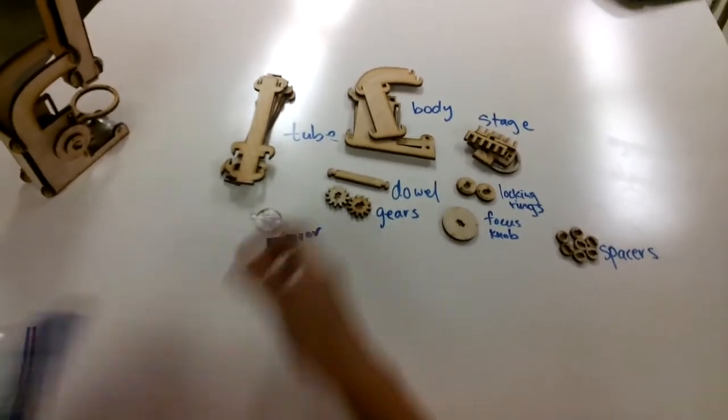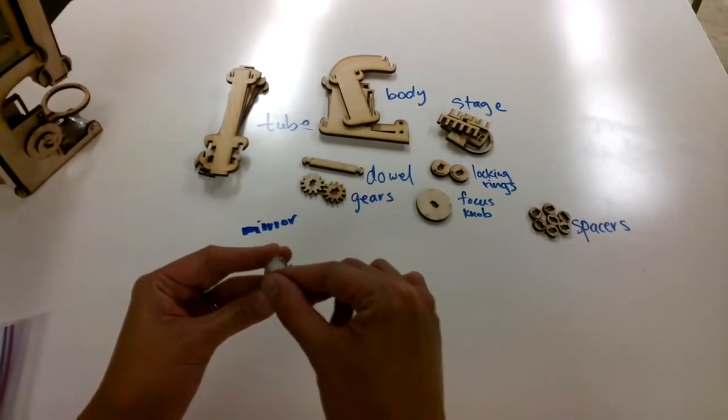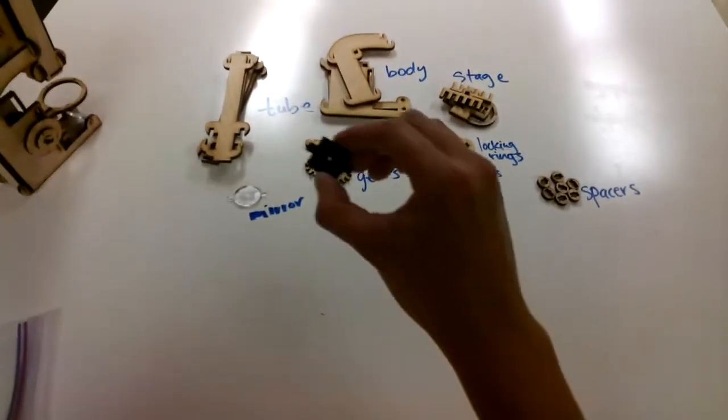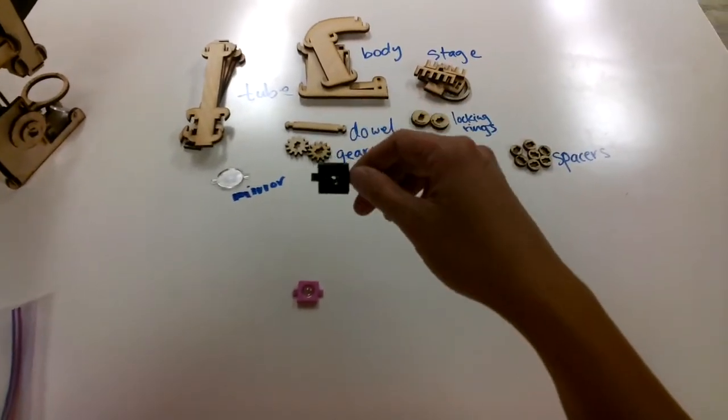So in the little mirror, what you'll notice is that it's covered with this little film. So use your fingernail and try to peel it off and you'll get a shiny little mirror. I'm not going to do that, but you should do that. Then you're going to need 2 lenses. So they're in these little plastic lens holders.